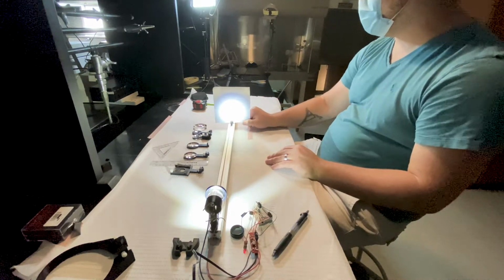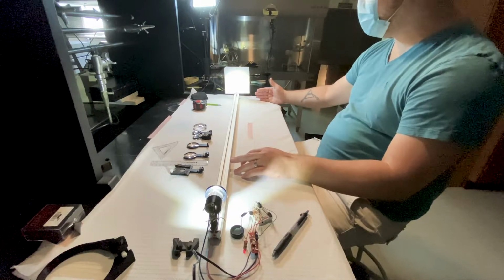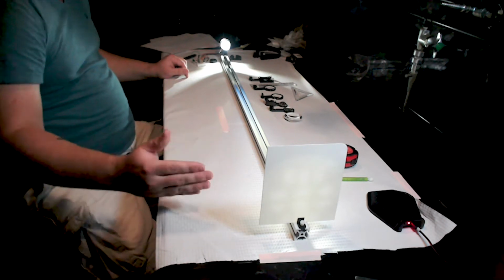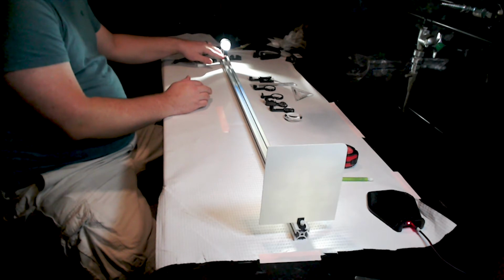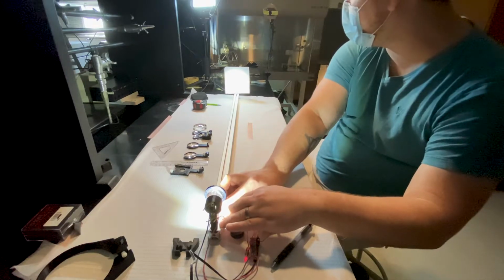So we'll say that at the end of this rail, that will be our ideal placement for our image to converge, so that anywhere in this space we know that we have more or less even illumination. And this is what we call collimating the light. So these lenses are not perfect, obviously, and so what we are going to try to do is get this guy as close to in focus at a very, very far distance away as possible.